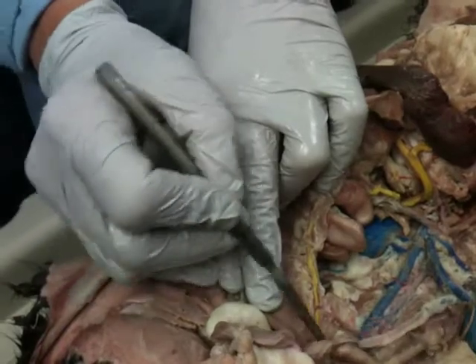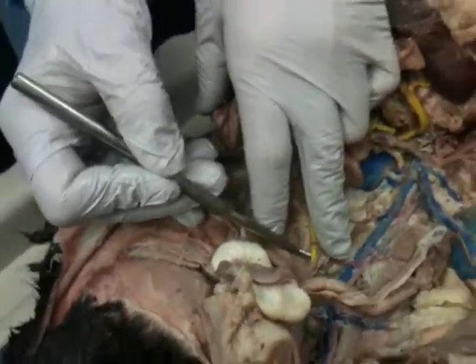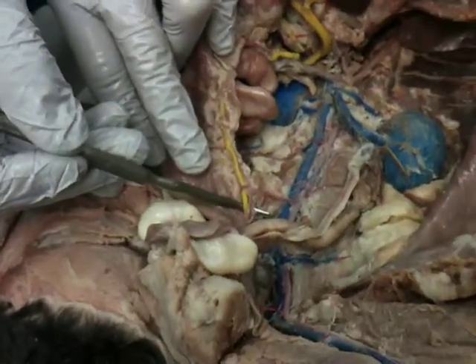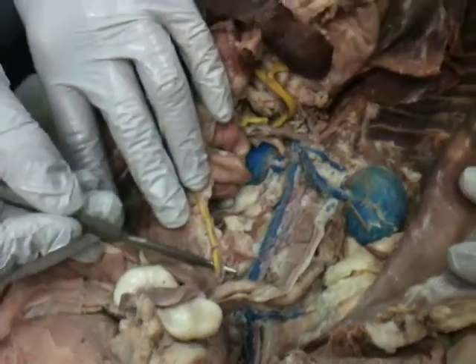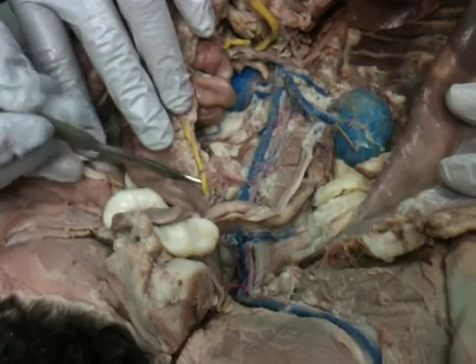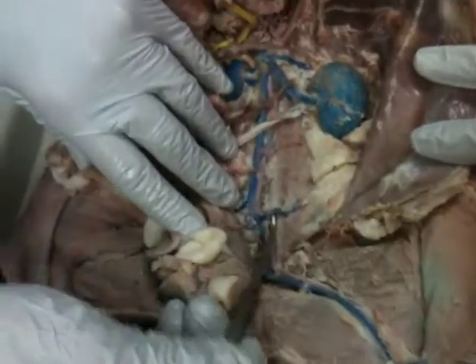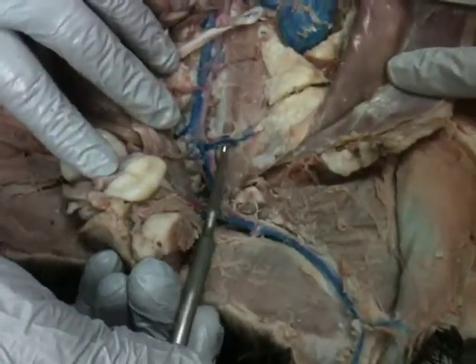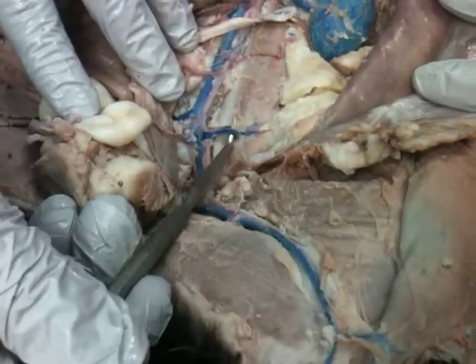When it goes inferior, it's going to give you hemorrhoids. So down here, we call this the hemorrhoidal artery and vein. But it's only the upper part of that, so we call it the cranial hemorrhoidal artery and vein. Those two there. Continuing on down here, this is our iliolumbar artery and vein, kind of in the iliac area and going to the lumbar area, iliolumbar.